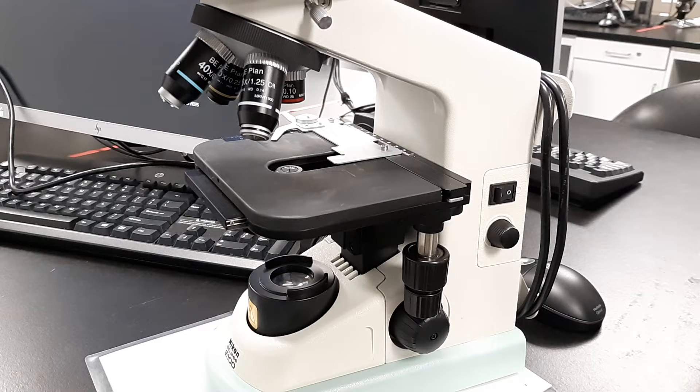In this video on how to use a Nikon microscope, we're going to quickly go through how to make sure it's turned on, properly illuminated, and other features to get you started.